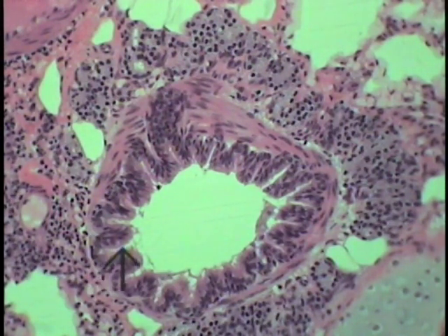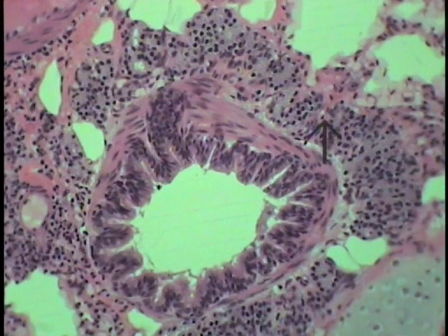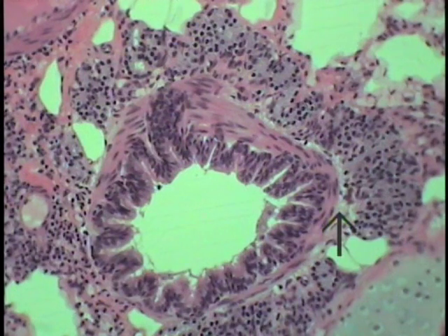Bronchial smooth muscle still retains its prominence. And if we look at this particular epithelium, it now perhaps will be lined by a more simplified form of epithelium, perhaps a ciliated simple columnar with goblet cells. As one goes distally down this conducting portion, the layers become thinner, the epithelium becomes simplified, and the cartilage and the glands and any lymphoid tissue associated with the bronchial tree will disappear before you actually go into a true bronchiole.